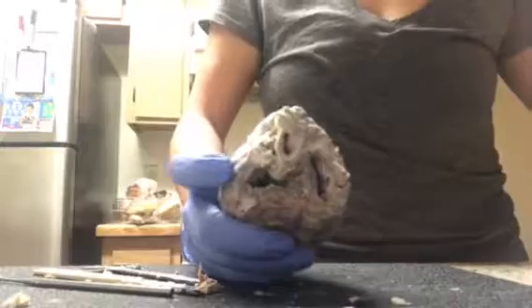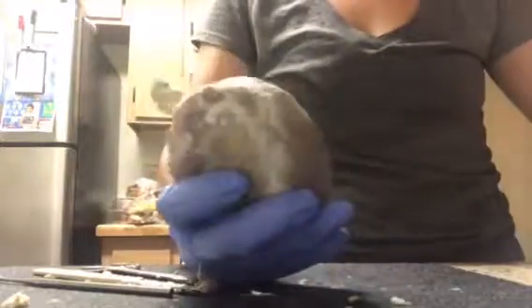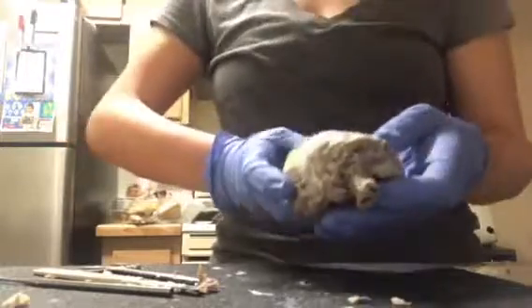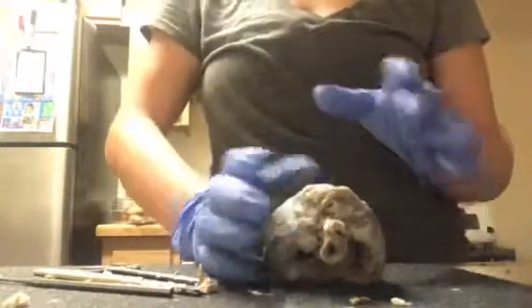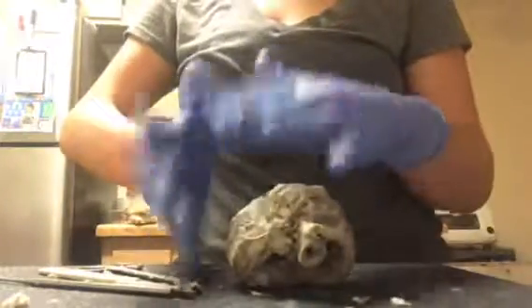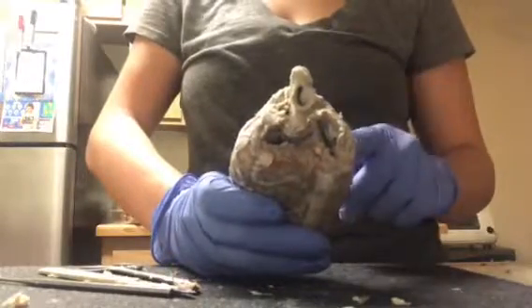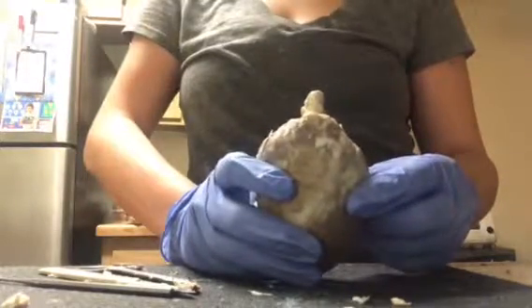Okay, so as you can see, this will be the anterior view, and then we have the posterior view. So when explaining the heart, when the anterior side is facing me, like this, we have the right and left atrium. When it faces me, the right atrium will actually be on the left side and the left atrium will be on the right side. When it is facing you, it will be the right atrium and the left atrium.